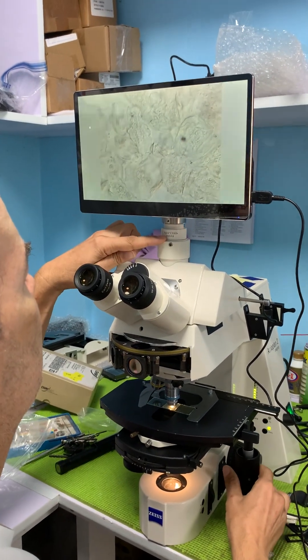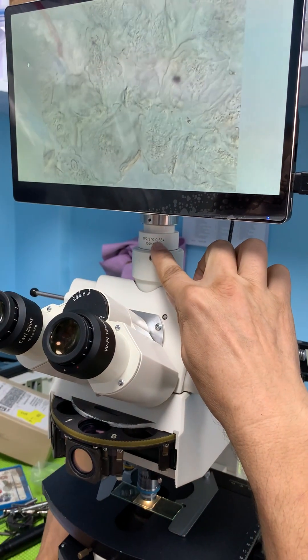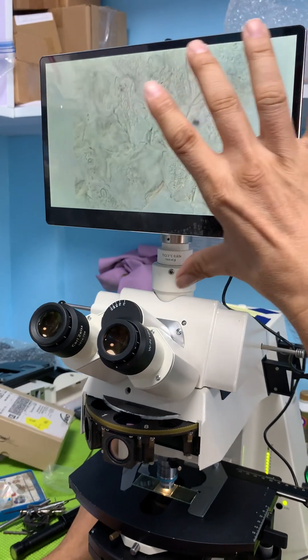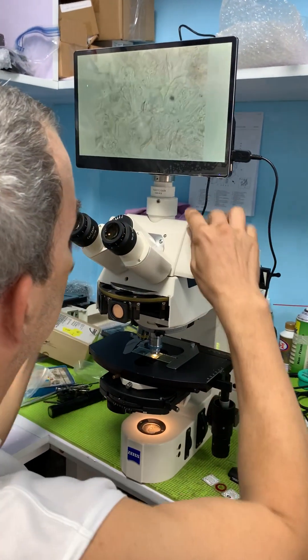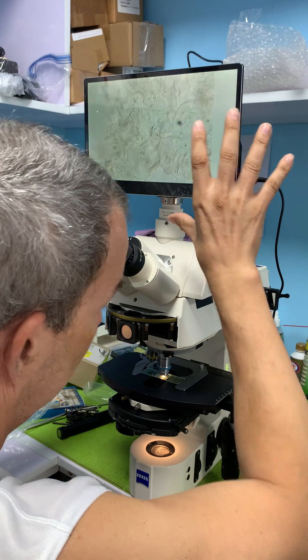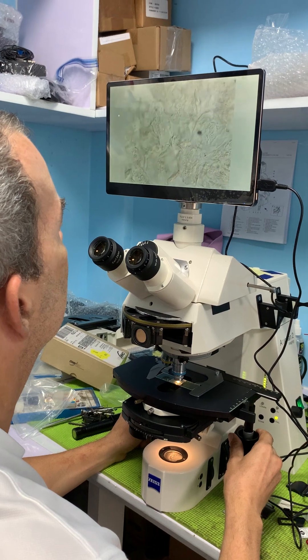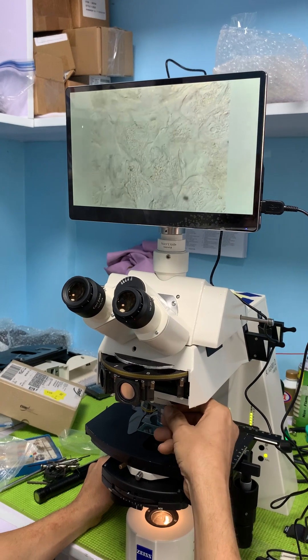I do have a reduction lens on here that's helping some, but I really need to change it from a 0.63x to something like a 0.35x to help with the extreme reduction — this camera is built integral to the screen.